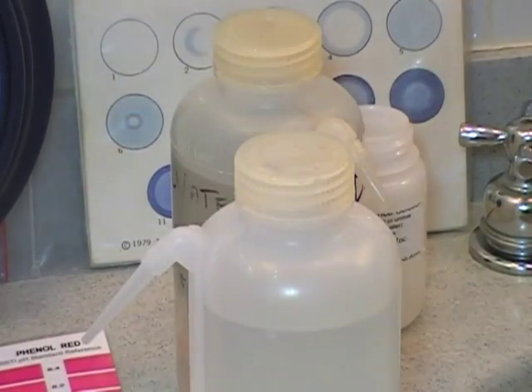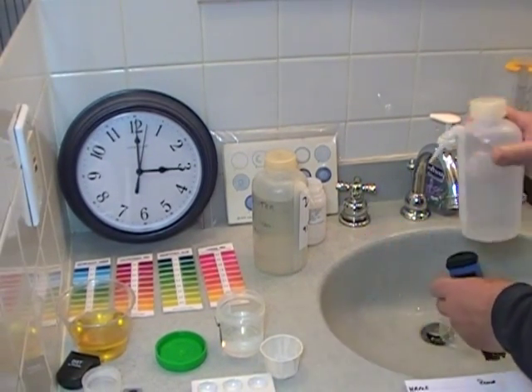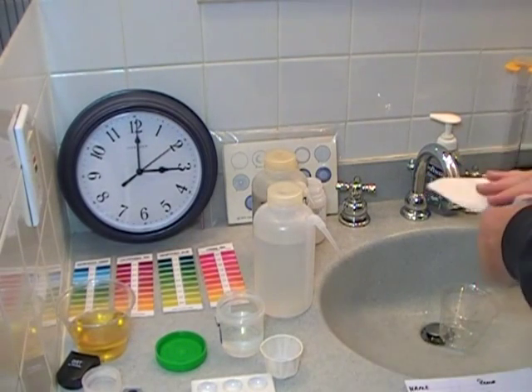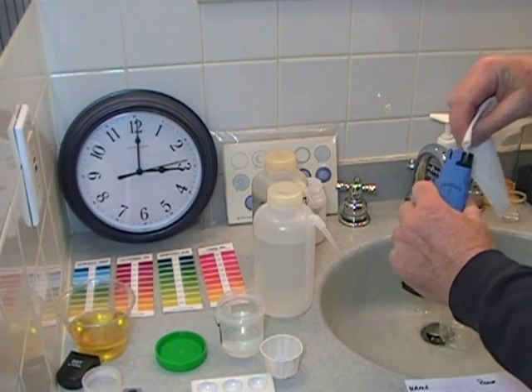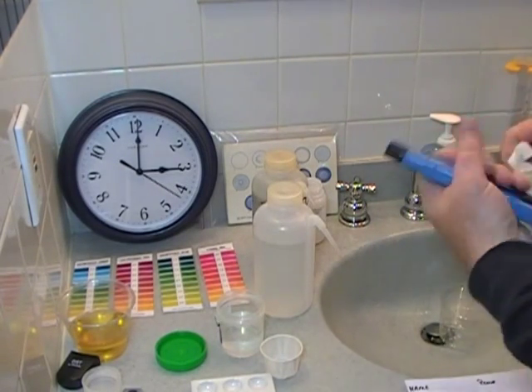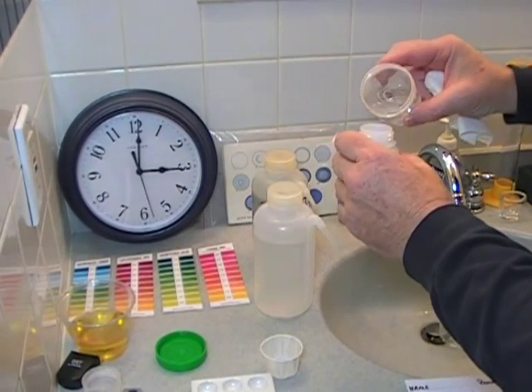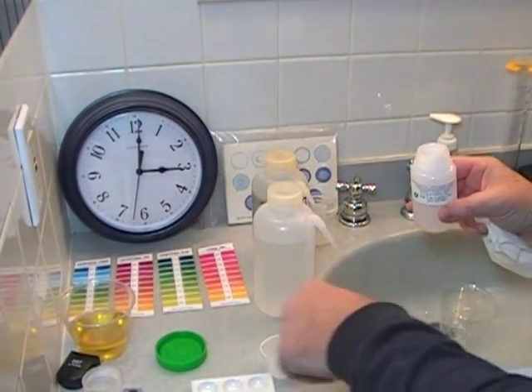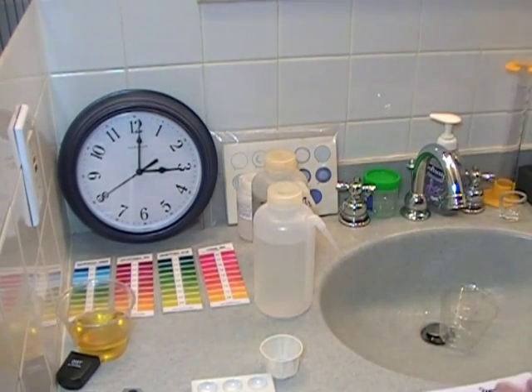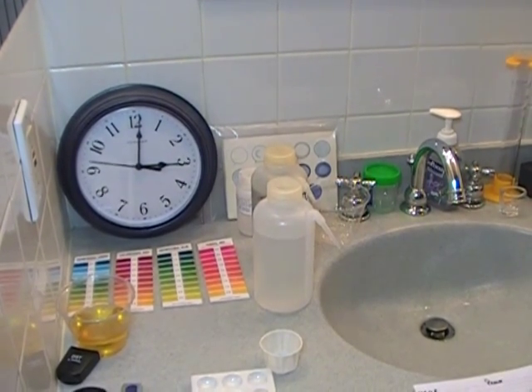Calibration is A-OK. Calibration of instruments is finished. We will now test the NO3, or the nitrate nitrogen.